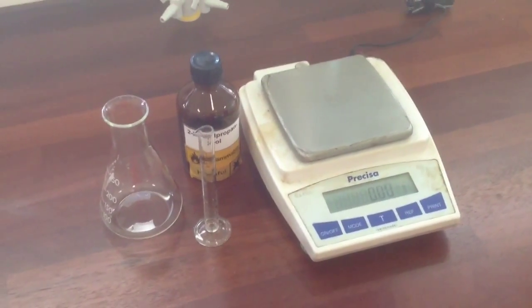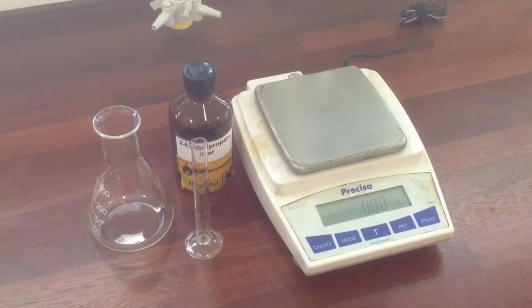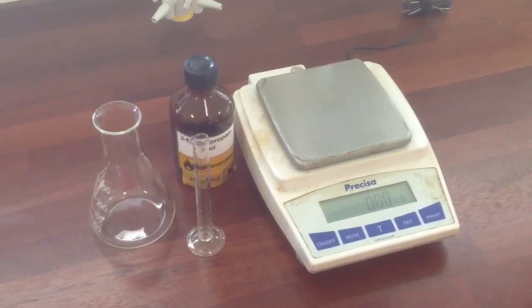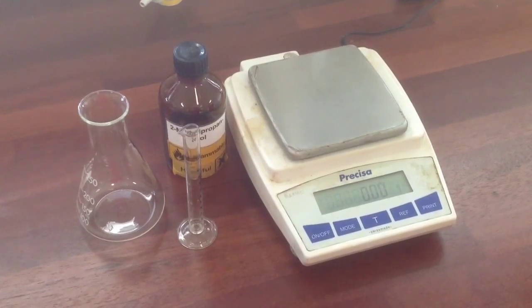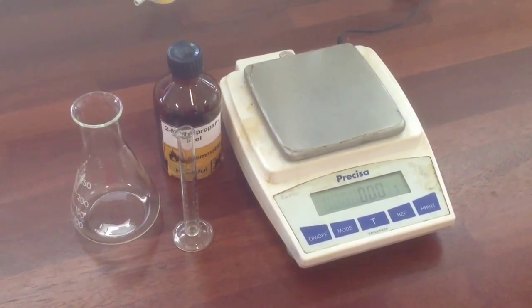First step will be to measure out some of the 2-methyl propan-2-ol reactant, and we're going to measure the mass of the amount we're using so we can work out the percentage yield at the end. You're going to need a 250 centimetre cubed conical flask, and bring it over to the balance where you'll find the alcohol and a 10 cm cubed measuring cylinder.